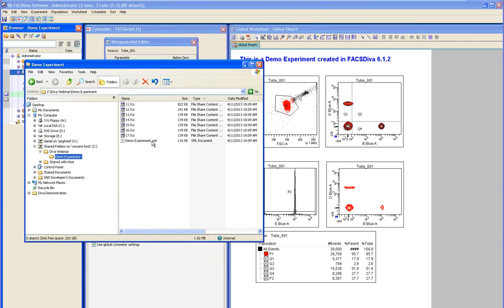We have a file called demoexperiment.xml. And this is actually what contains all of the information about your plots and gates. And then you have a series of FCS files, so what look like data files. Now the first thing I am going to do is delete these data files.